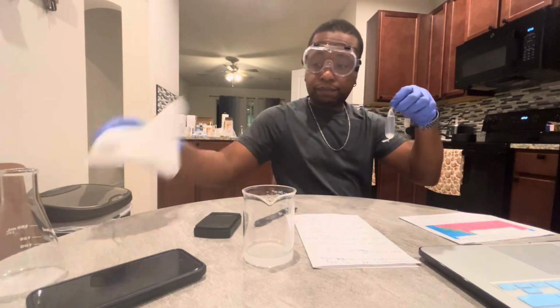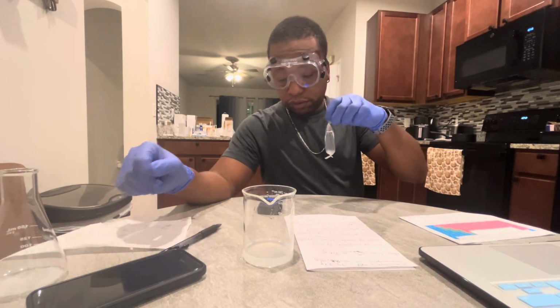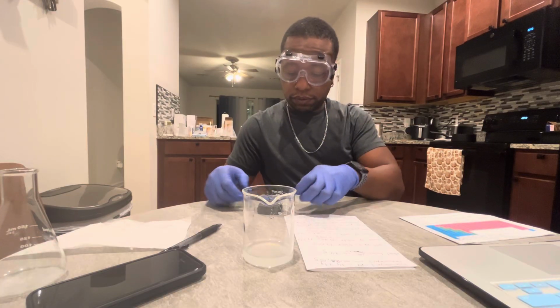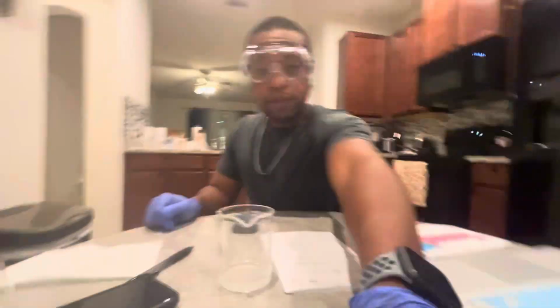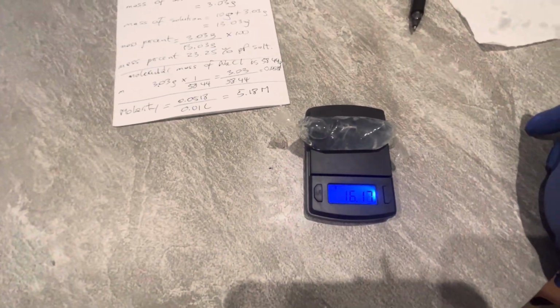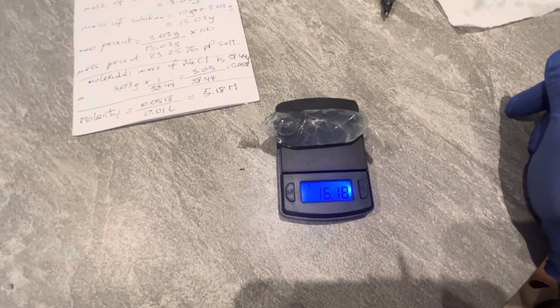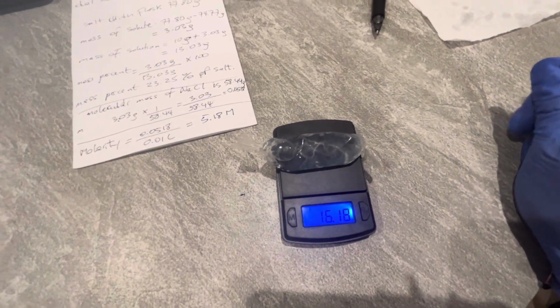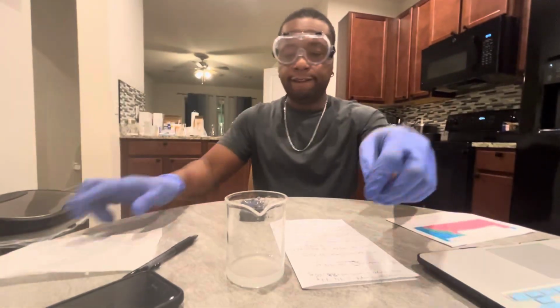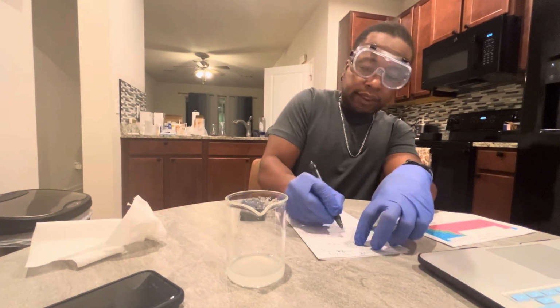Okay. I'm reading 16.17 or 16.18. 16.18.